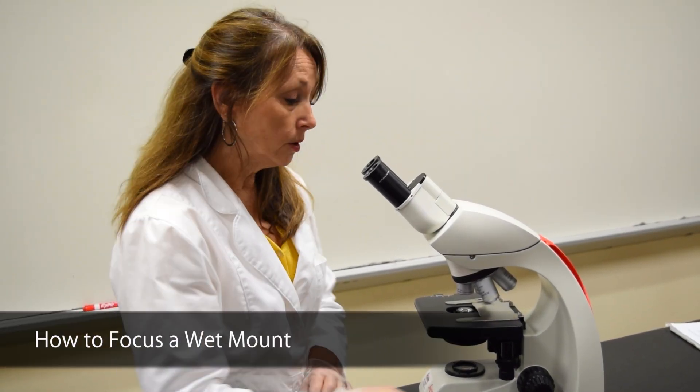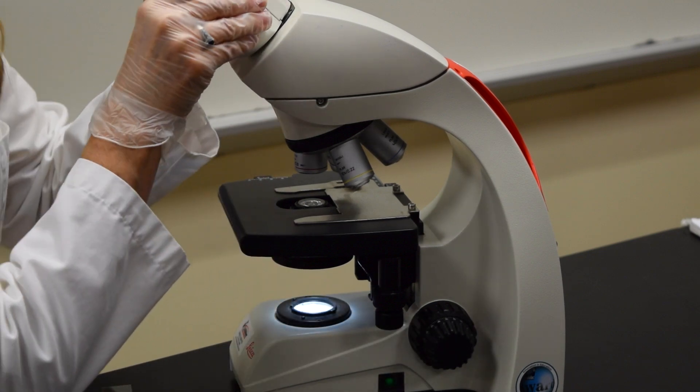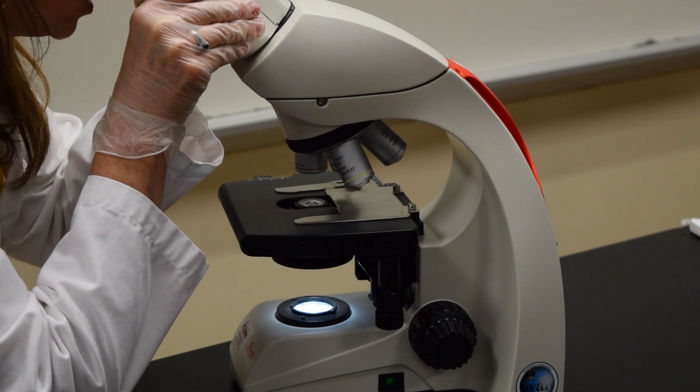This demonstration is to show you how to focus a wet mount. Turn your microscope on. Adjust the eyepiece to accommodate the distance between your eyes.